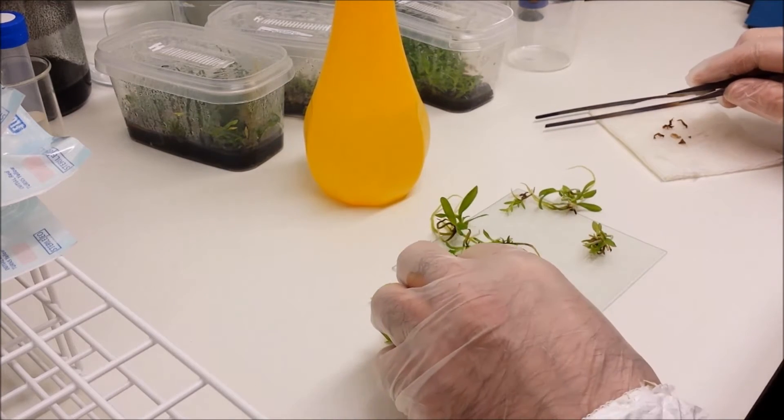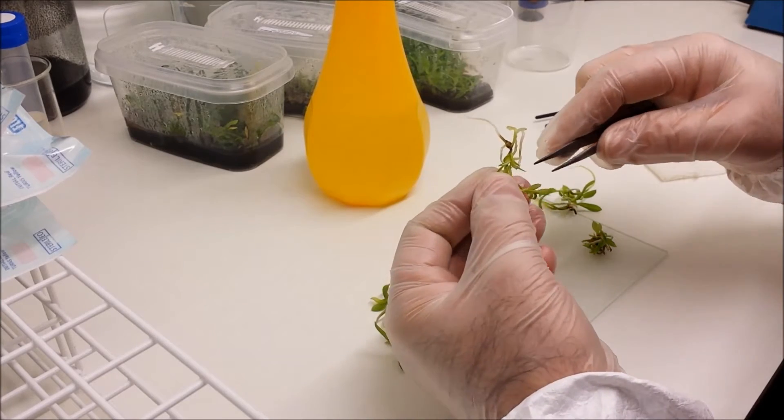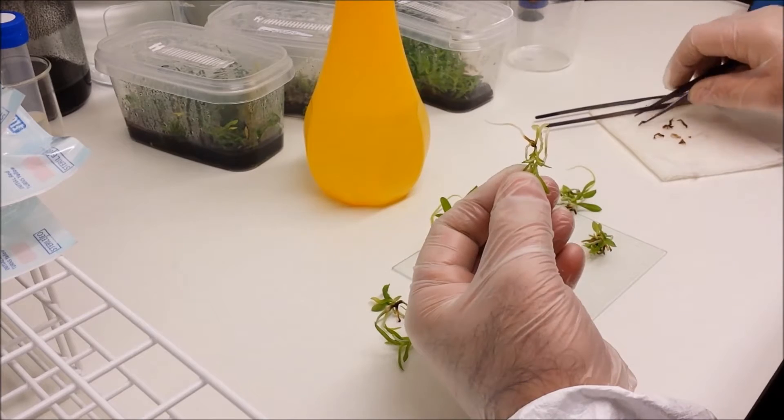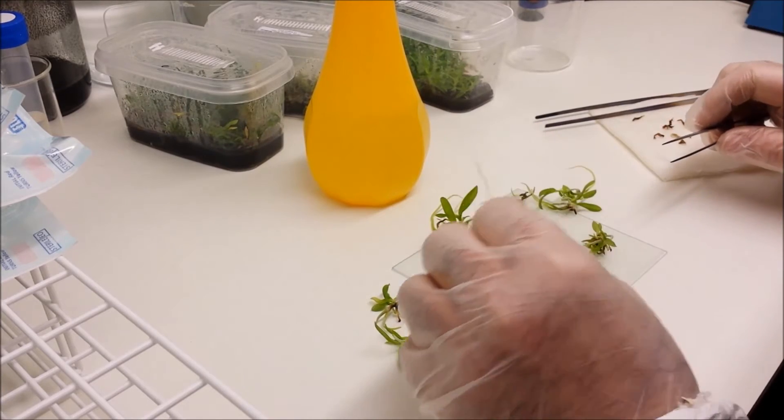And don't forget I'm putting these down but it's all been sterilized. As I keep saying, sterilize, sterilize, sterilize.